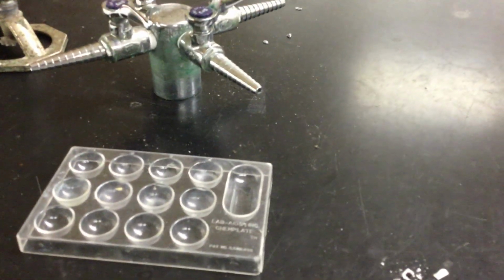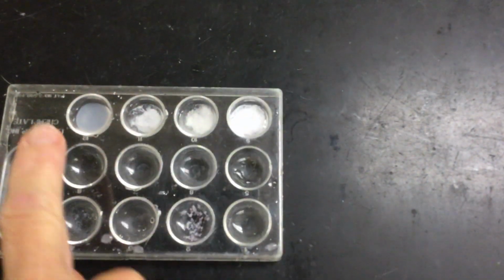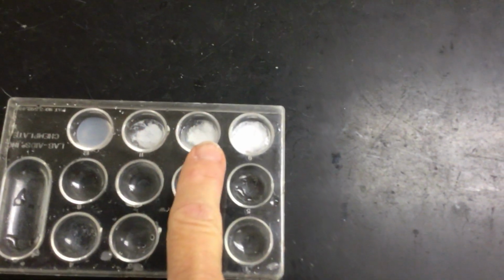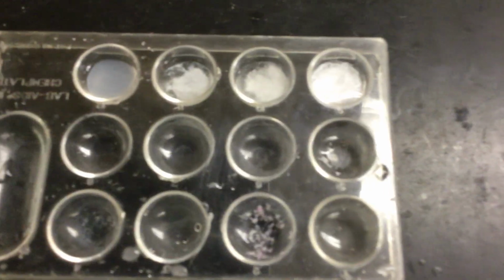So what we're looking at is the reactivity for each of the elements. So we're going from top to bottom in the column here. So it goes magnesium, calcium, strontium, barium on the periodic table. So here are my results. Okay, so in this top row, this is magnesium, this is calcium, this is strontium, and this is barium. And I'm not sure how close I can get and not keep it blurry.